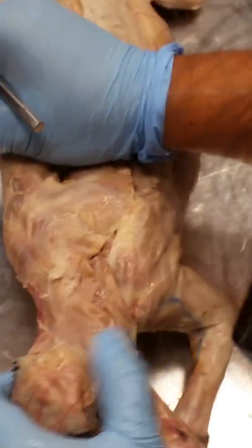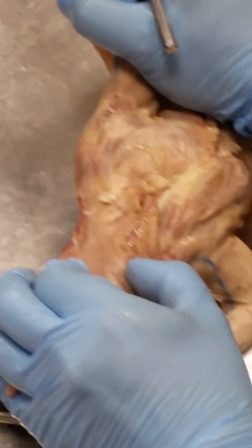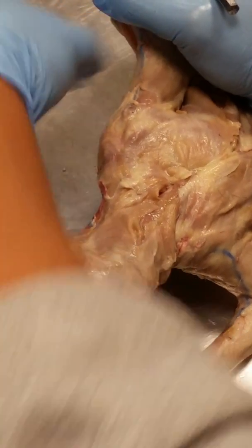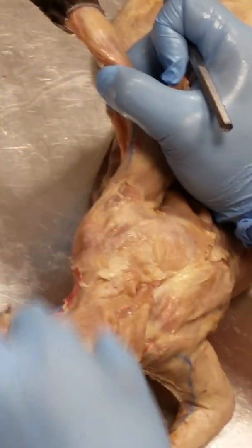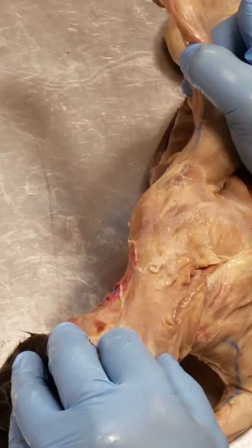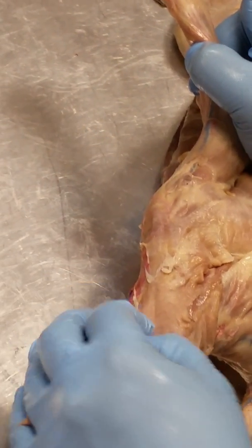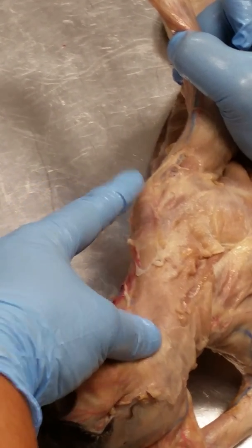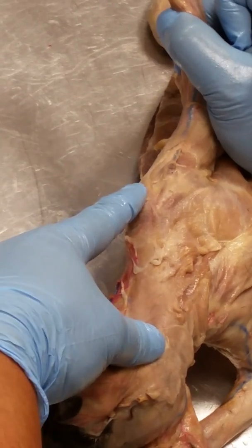Now, if you take a look at the cat's arm and neck, you can see that there's this big long muscle that runs from the neck to the shoulder and then the shoulder to the arm. Okay, neck to the shoulder, shoulder to the arm. Looks like one big long sheet. That's actually two muscles. From the neck to the shoulder here, that's the clavotrapezius. The clavodeltoid, or clavobrachialis, as Paul likes to call it, is from the shoulder to the arm.